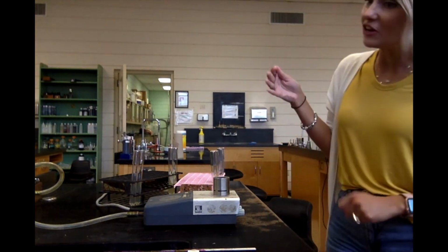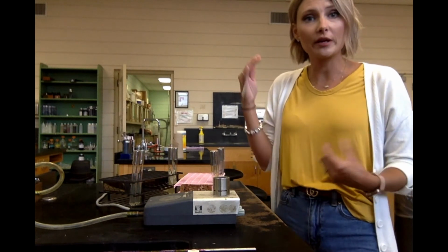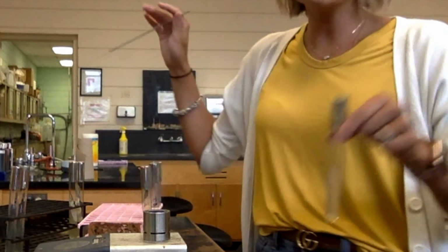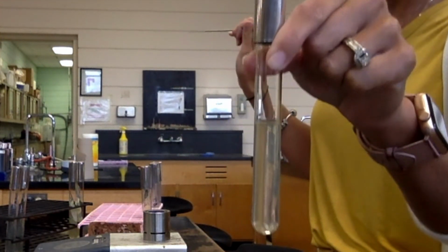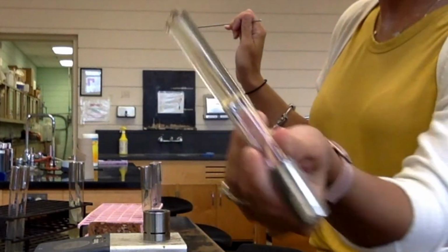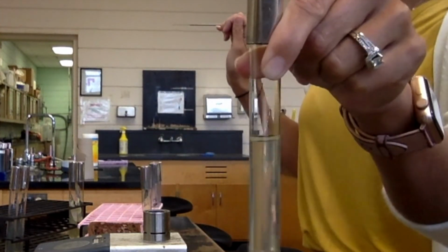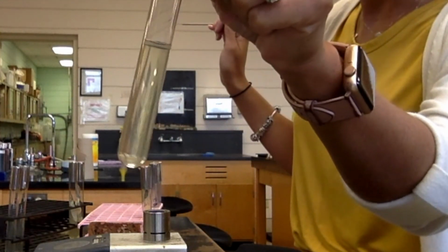So, of course, we're going to let our needle cool a little bit because you don't want to go in with a hot needle because you're going to burn the bacteria. So we're going to let it cool just a little bit. And while it's cooling, I'll show you, this is my motility stab. So it looks like that it's broth, okay? But when you turn it upside down, it doesn't move. But you can see that it's kind of jiggly, okay? And that means that there's less agar there. So the bacteria has the ability to move, okay?